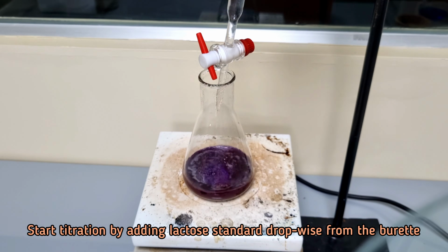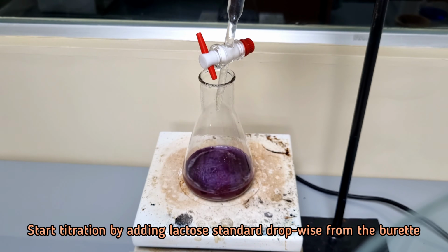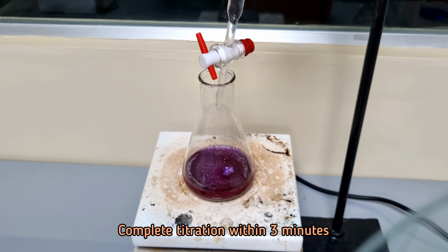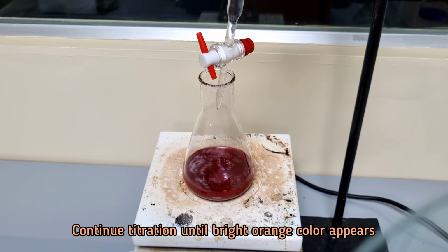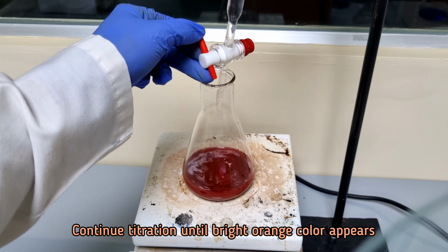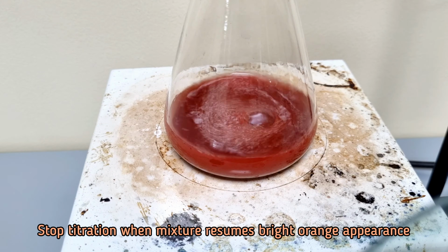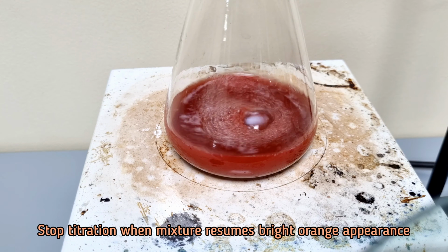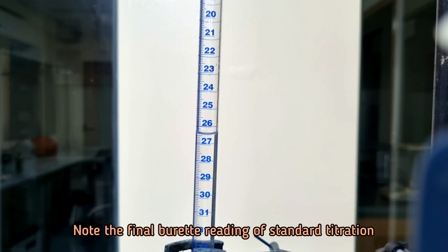From this stage, standard titration should be completed within 3 minutes. Stop titration when the blue color removes completely and bright orange color appears. Note the final burette reading of this standard titration.